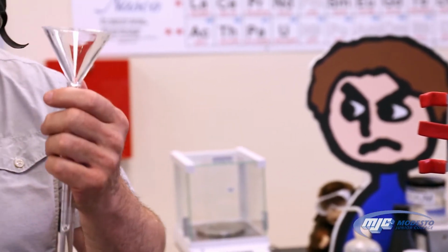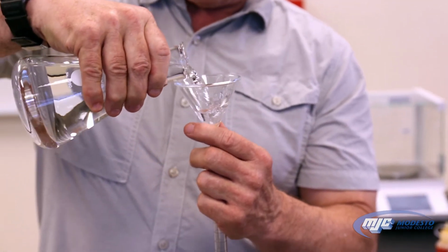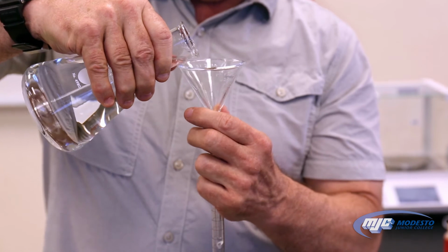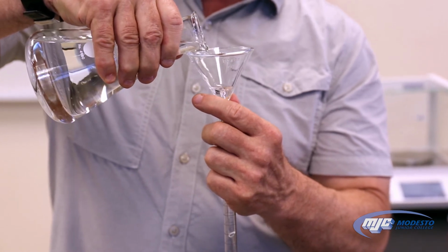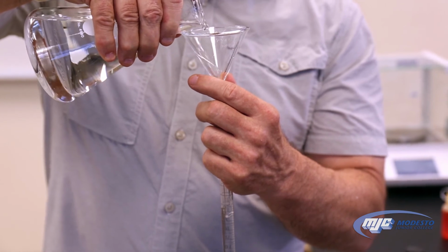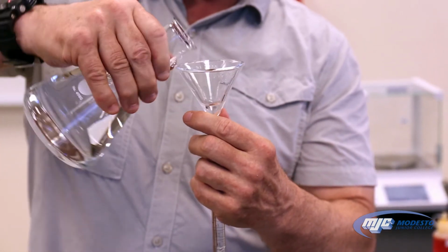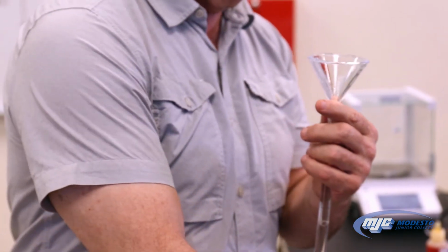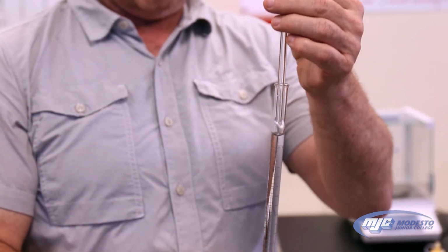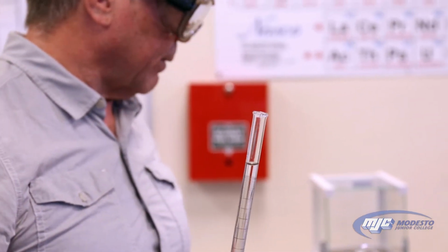So it's a little bit easier. Make sure that's closed if you bring it down like this instead of trying to pour it up there, because that's sometimes a disaster. When you add this, you want to add it just somewhere above, or close to, the top mark. And so that's a good place to start right there.